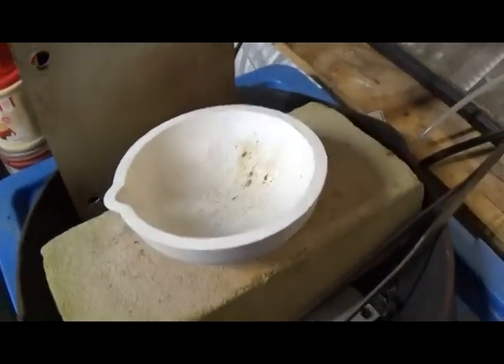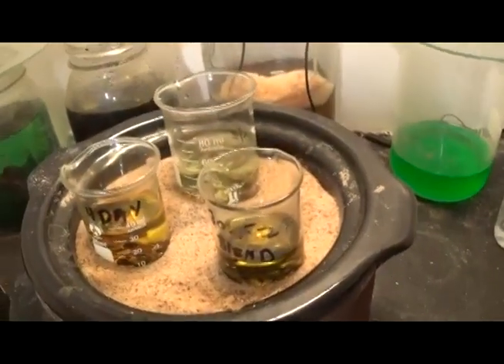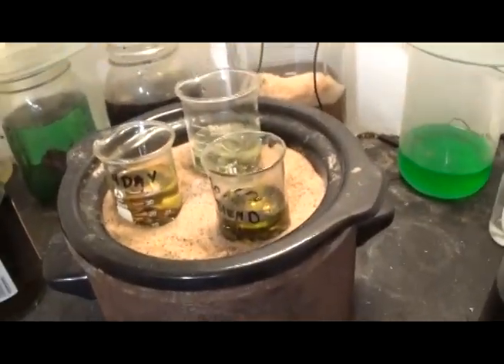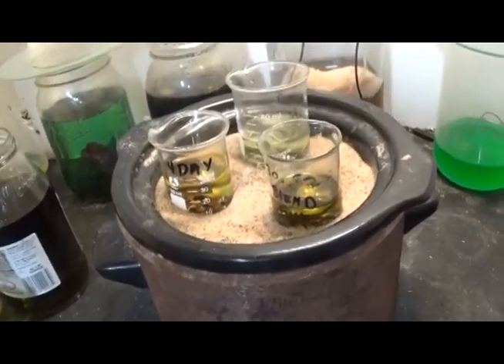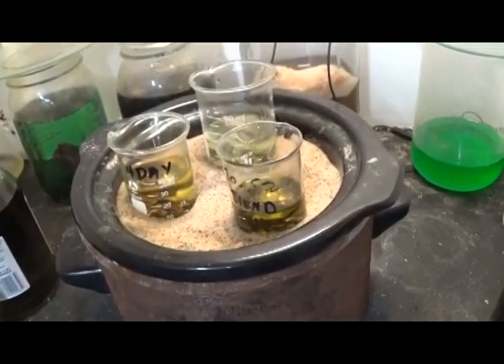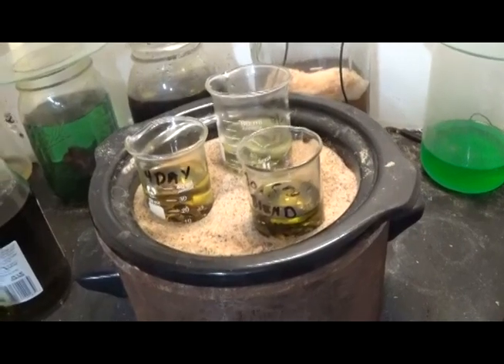Got a little crud come off one of those samples but it looks relatively clean, didn't smoke very much. Those are samples in solution of varying concentrations and other batches of solution — not all the same. The clock starts now. It is 20:30 hours and we'll check on this, maybe even in the morning.